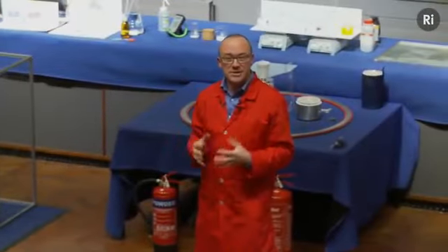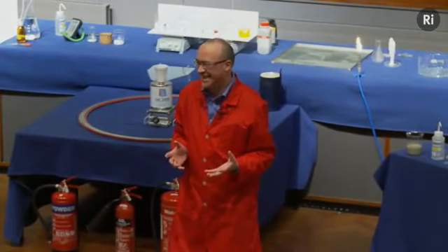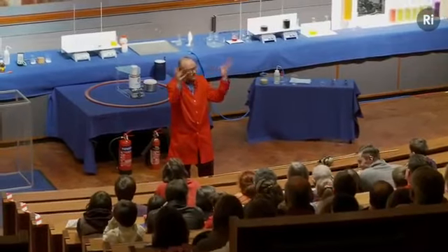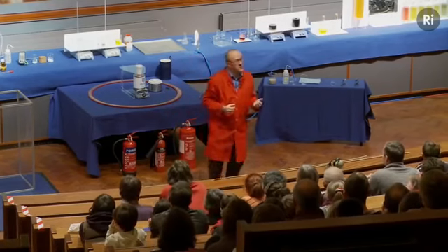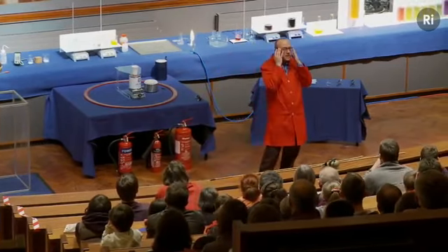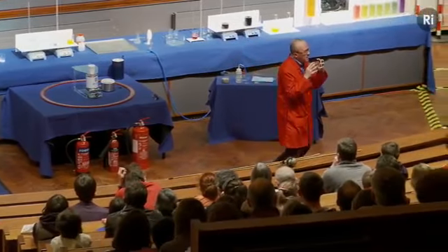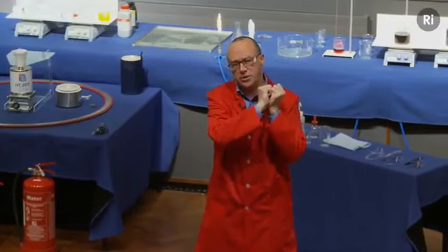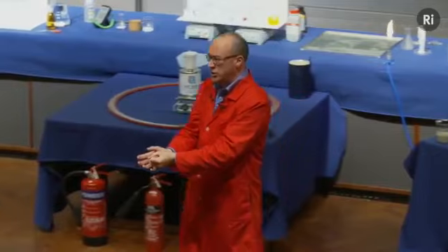So I think you will have noticed in that reaction that energy was released. Clearly. So we got a lot of noise, we saw the flame, we saw the light, I could feel the heat, and probably you in the front row could as well. So energy was released in that reaction. So what was happening is that the starting material, the hydrogen and oxygen, were in a sort of state of high energy. And as a result of the reaction, they moved to a state of low energy.